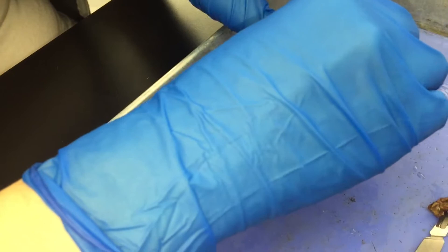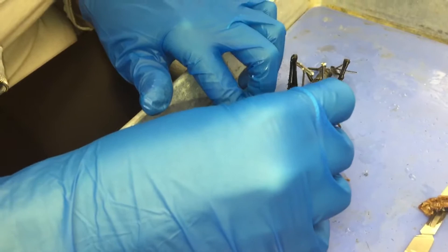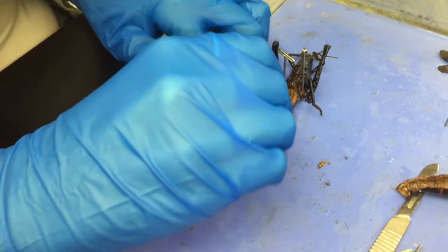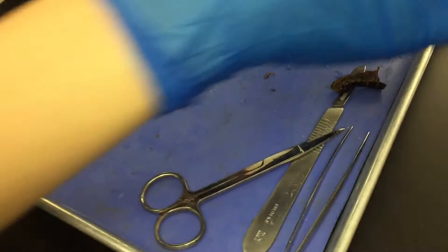So we're sending him these videos, right? I think this is good — he's already a celebrity on YouTube. I got those other ones uploaded yesterday. Look at the heart and the tail, just below the strip of exoskeleton that you made.